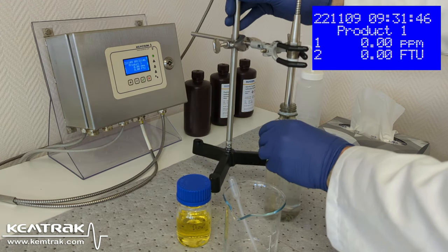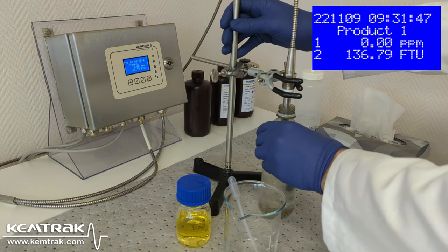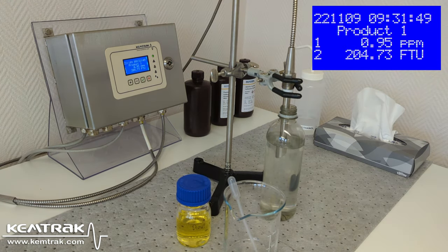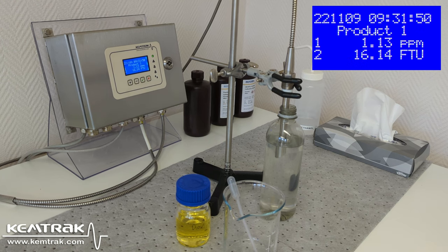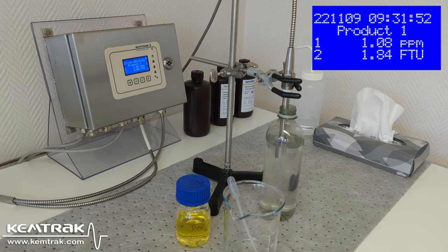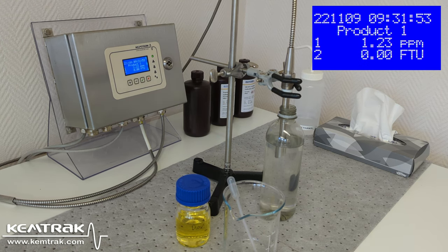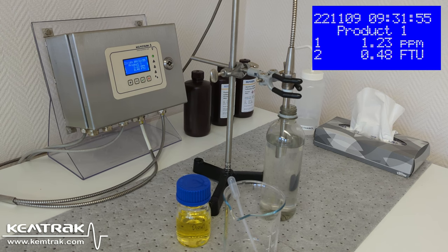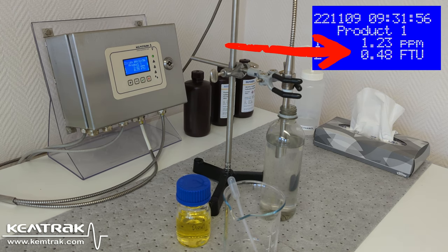I now measure the signal. Success! We have detected the leak.